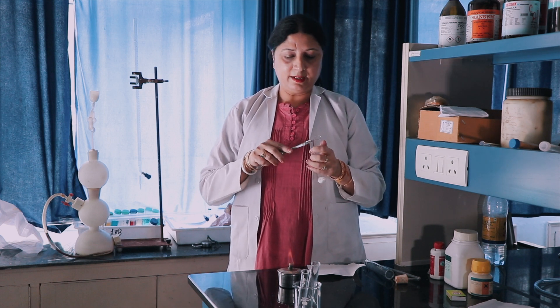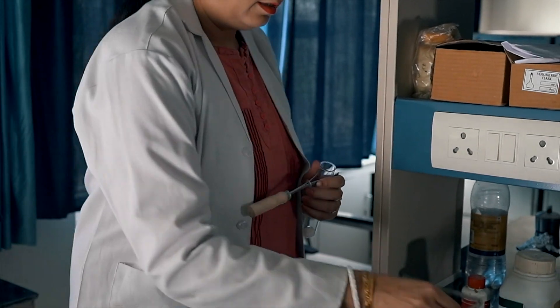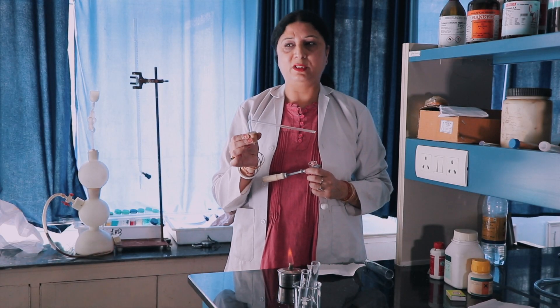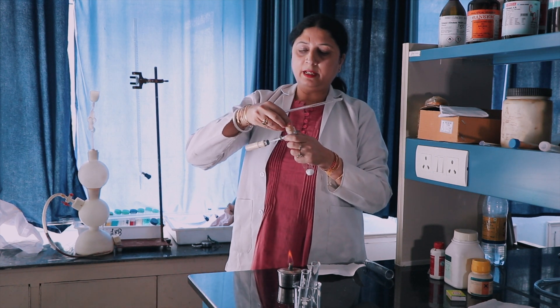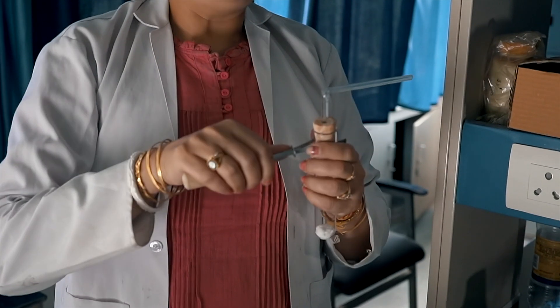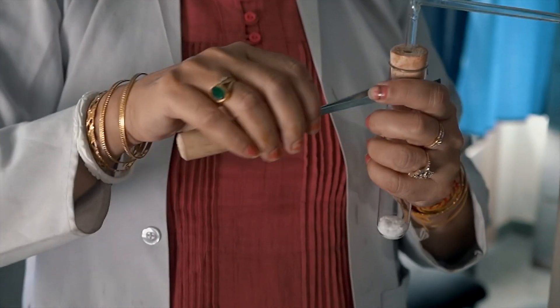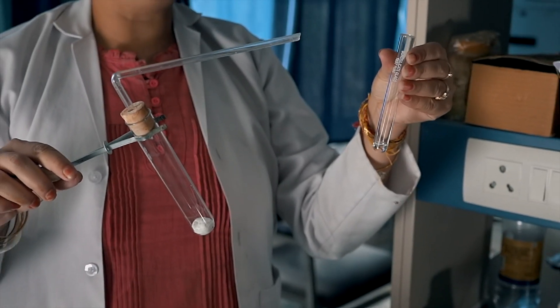Now I will heat this. This is a delivery tube; the function of the delivery tube is to carry the gas molecules. I am fixing the delivery tube so that when the gas is produced it can be tested. In this test tube I have taken acidified ferrous sulfate solution.